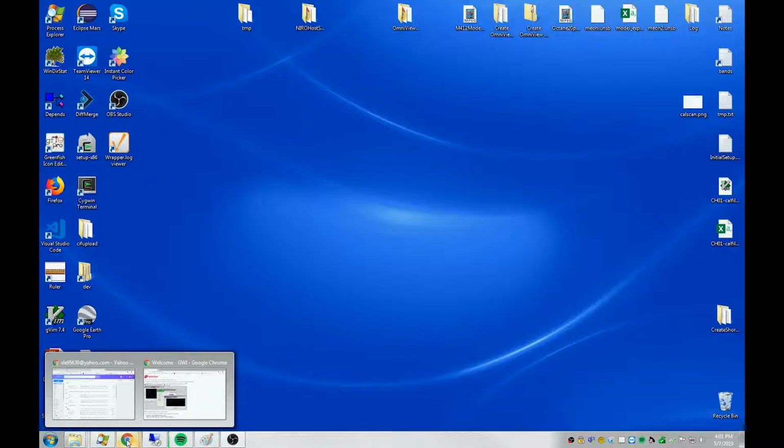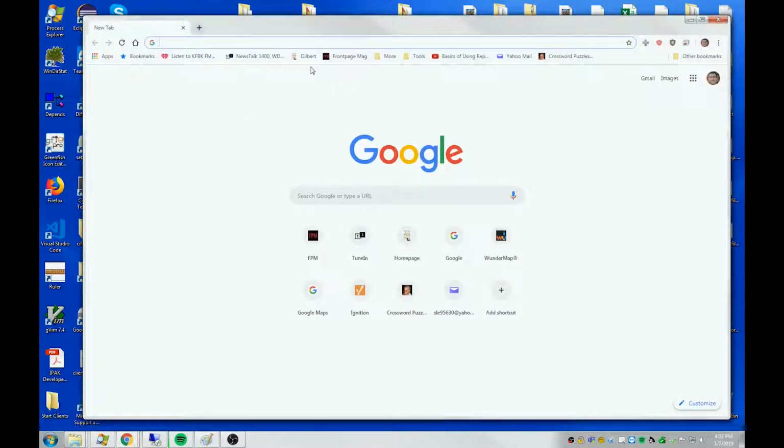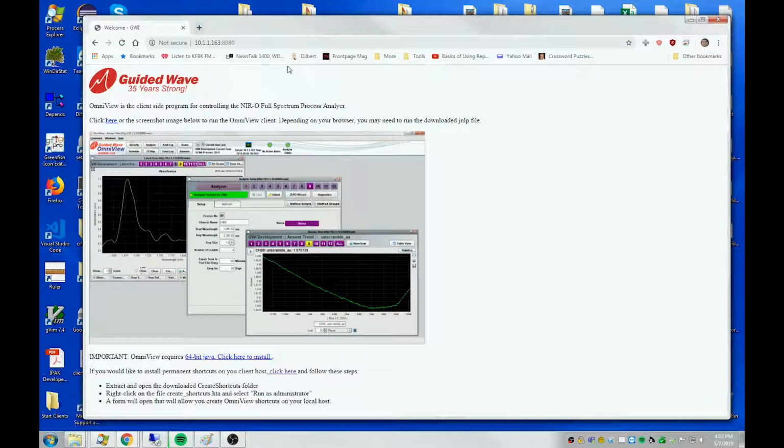One way to communicate with the server is through a browser. So I'm using Chrome. You could use any browser that you like, Firefox, Internet Explorer. You need to know the IP address of the NIR-O analyzer. This part is the IP address, then a colon followed by a port number 8080. If you go there, we display a small web page which provides a link. This image here and this click here are links to download a JNLP file, which is a Java file for starting network launched applications.